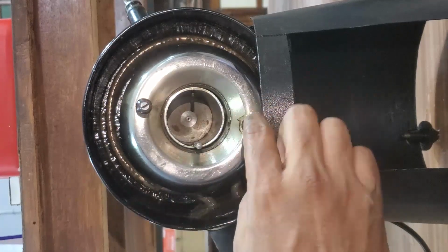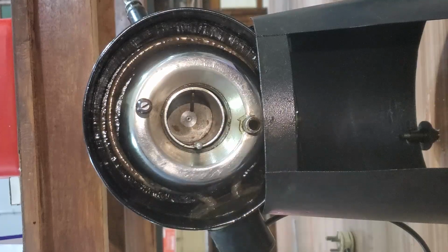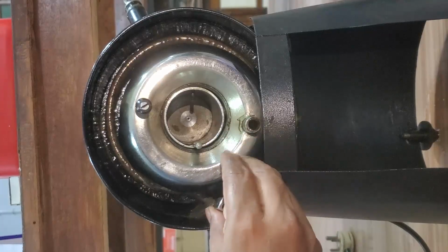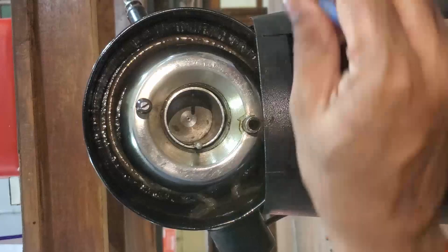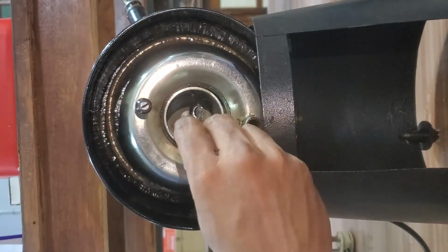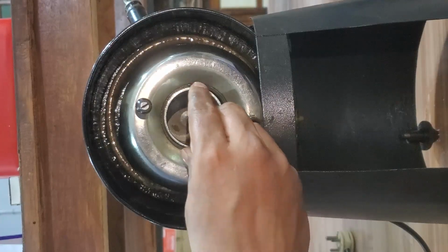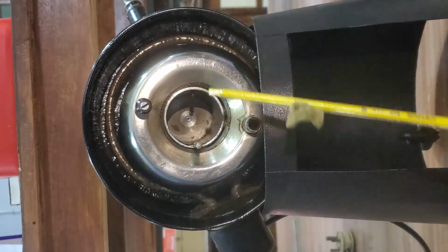So we'll keep one thermometer inside the cup also from this attachment. Here the outside attachment is there. There also we'll keep one thermometer like this. Inside also we'll keep one thermometer like this to see the temperature of the oil inside, and outside also we have the provision to keep a thermometer.